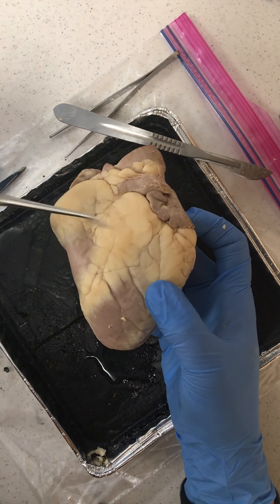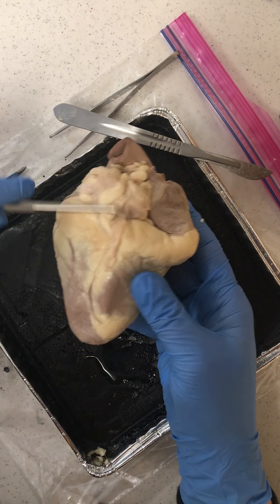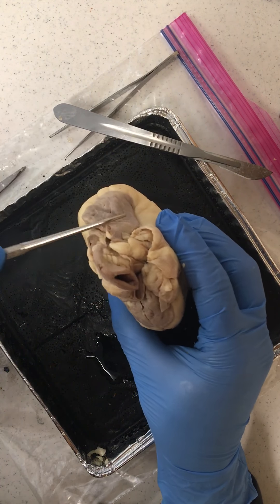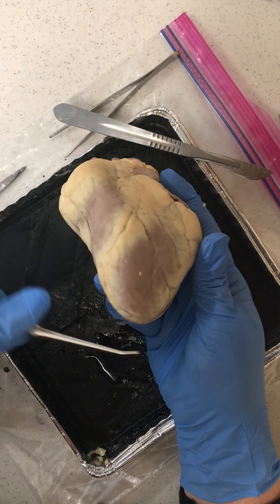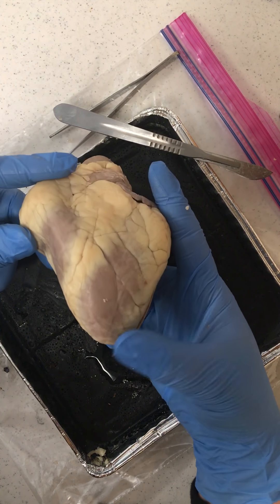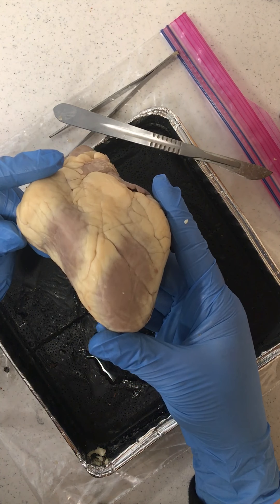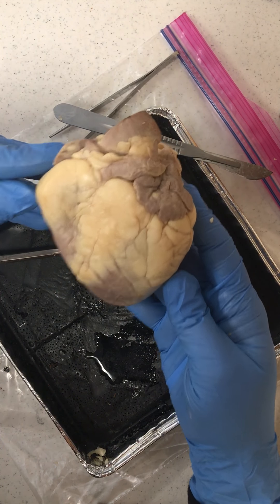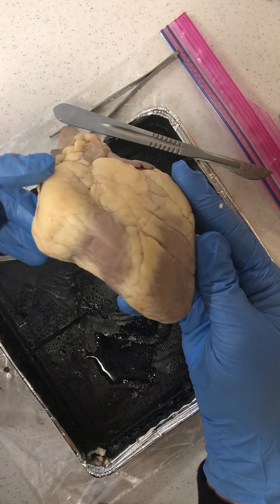This is the anterior portion of the sheep heart, the posterior section, the base where the blood vessels are entering and exiting, and the apex which is this pointed section of the heart — also the side of the left ventricle. The heart is not so much straight on but more positioned off to the side.